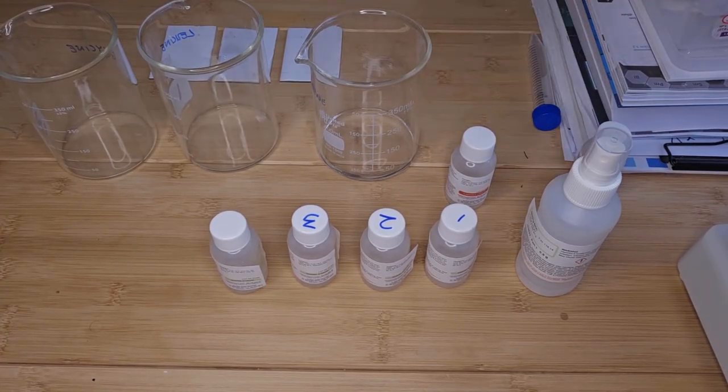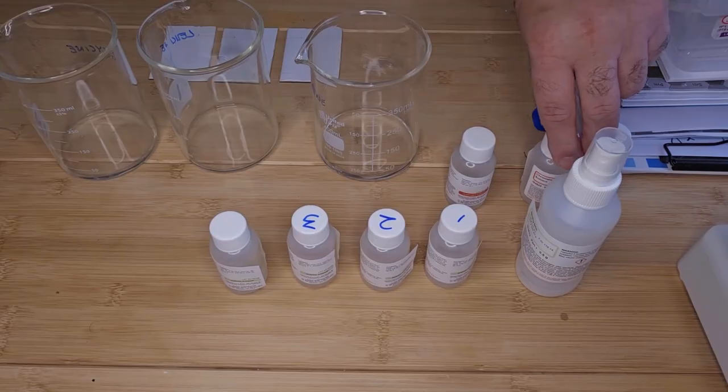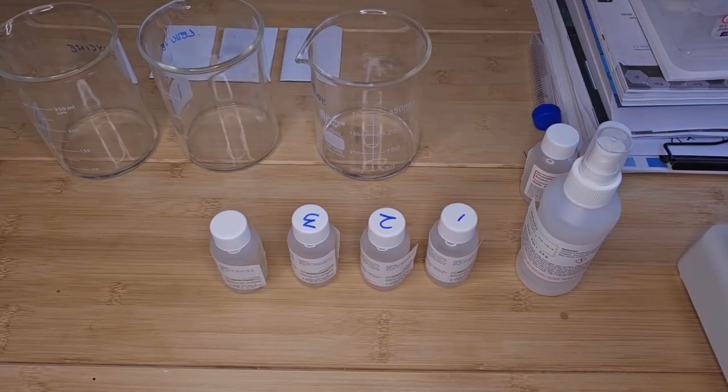The application line is where we apply the sample. If you put too much solvent into the beaker, into the chamber, the sample that you apply to the plate just dissolves in the solvent.